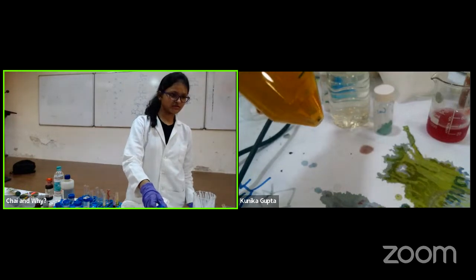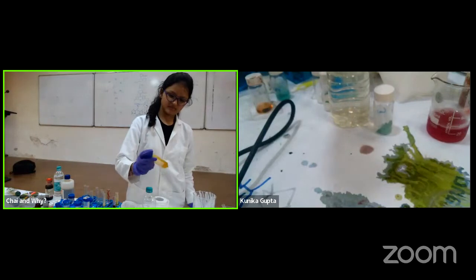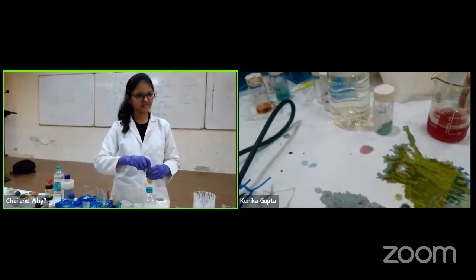It is not looking red. We thought of also we need to do it. Yes? We need to do it and do it later. We'll do it later. Do something else.